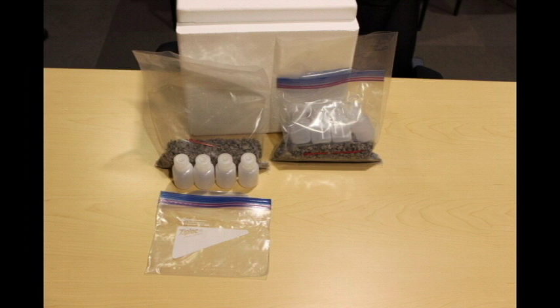Now we go to pack the samples. Place the appropriate aliquot of sample into each primary container included in the shipping kit, ensuring that you put the lids on tightly when you are done. You should also tape the lids closed with vinyl electrical tape or something similar so that they don't come loose during transit. Place no more than four vials in each of the Ziploc bags included with the kit and then seal those bags. Place those sealed Ziploc bags into the bags with the sorbent material and then seal those bags with the included zip tie.